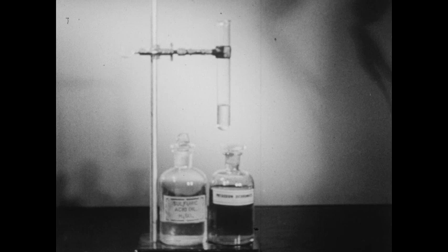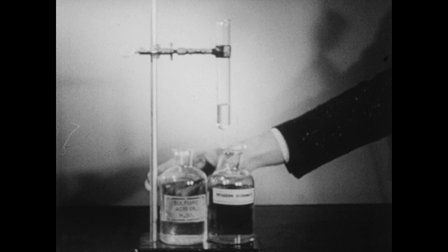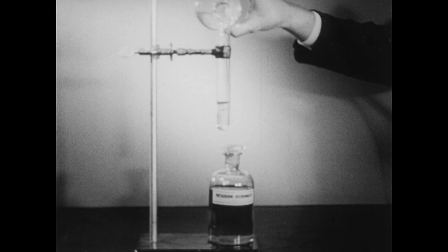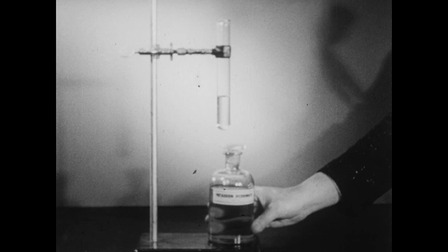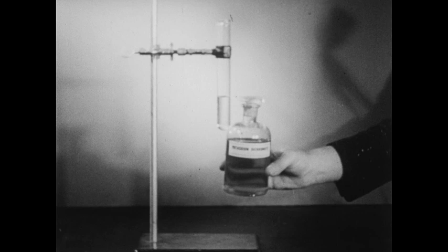We will now examine the reaction between acidified hydrogen sulfide water and potassium dichromate solution. In the test tube, we've placed a few milliliters of our hydrogen sulfide water. To this hydrogen sulfide water, I'll add a small quantity of dilute sulfuric acid. We'll now add the potassium dichromate solution. You should notice that the dichromate ion has an orange color, and then observe the color change that takes place as the reaction proceeds.